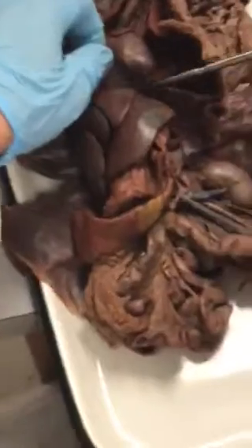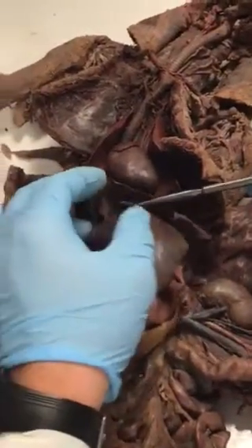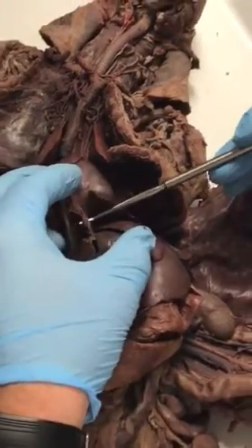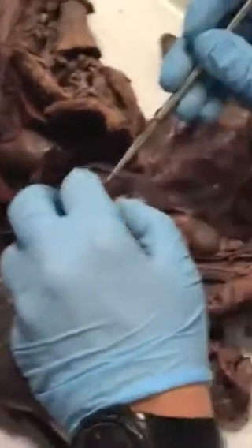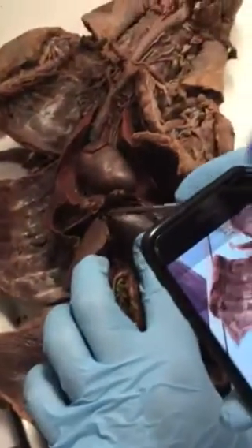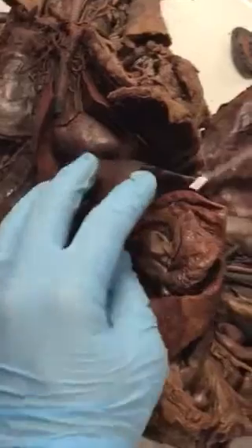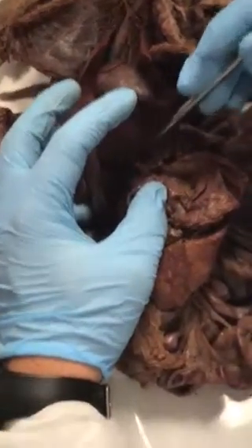And right above our liver, we get our diaphragm. And then in between the liver and the diaphragm is this ligament, which is called the falciform ligament. Opening up the liver, we see this pouch in here, which is the gallbladder. Underneath our liver here, back in the middle portion where everything connects up, would be our bile duct.